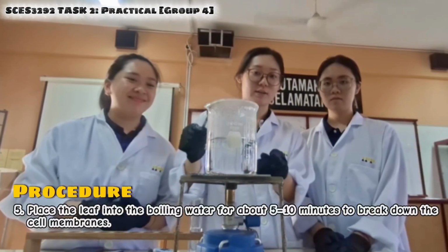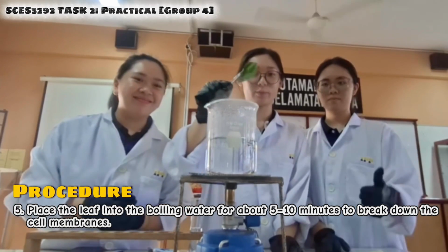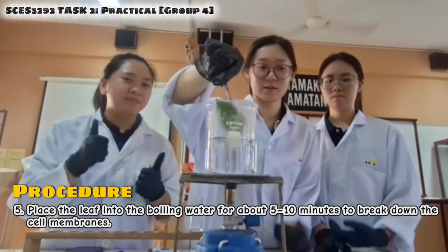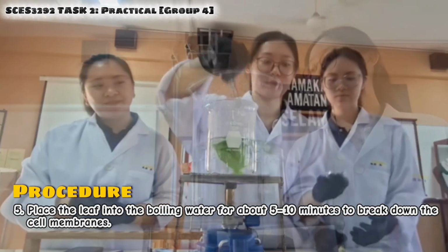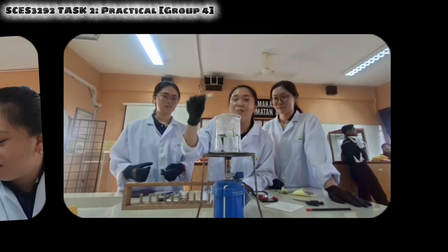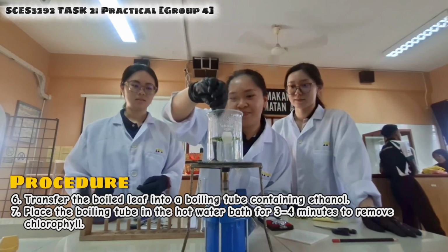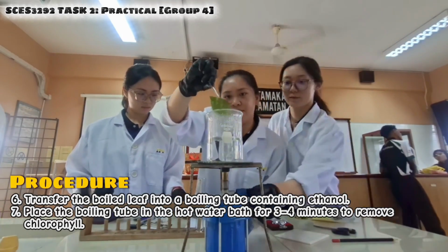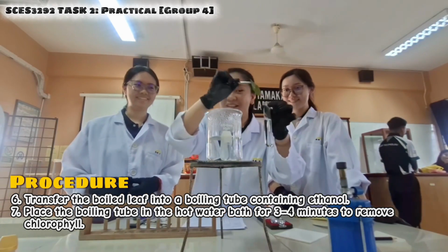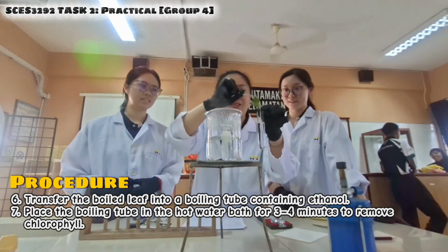Okay, so now the water is already boiling, so we are going to put the leaves inside the boiling water for 5 to 10 minutes. Now we are going to take out the leaf and transfer the leaf into the boiling tube containing ethanol.